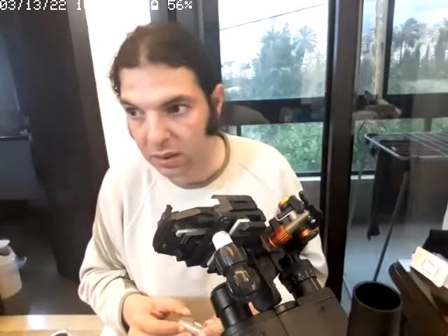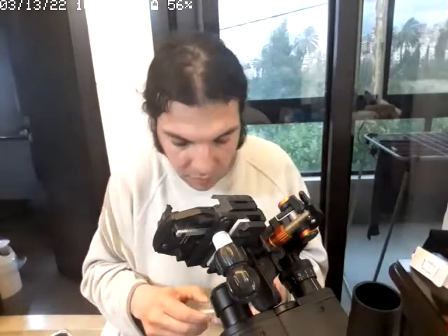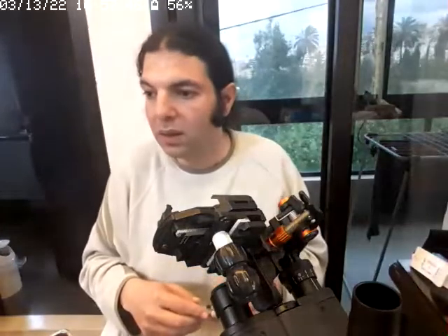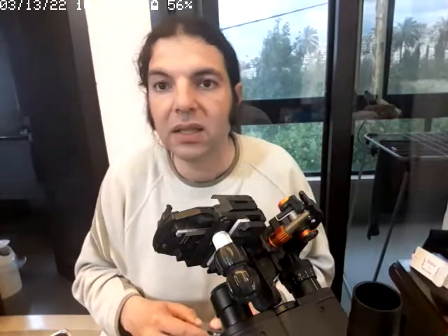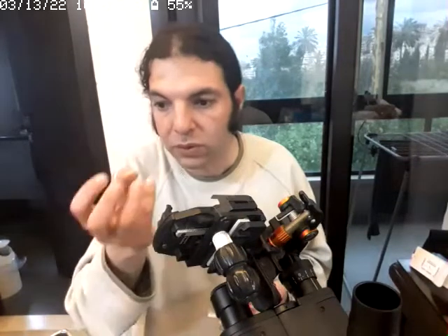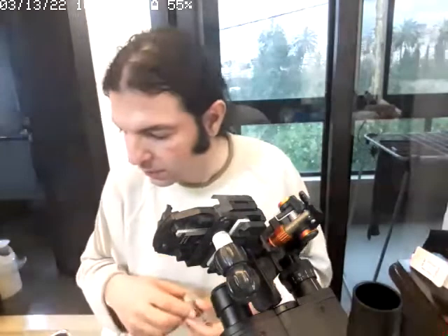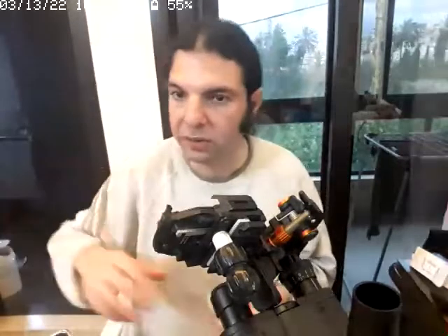What makes us use the color filters is just to emphasize seeing something. There's something we want to appear more than others, and see only things which are in red, for example.